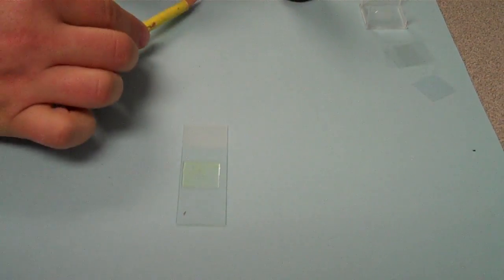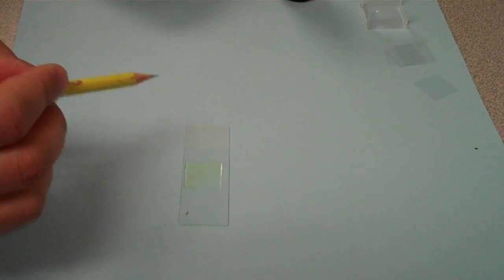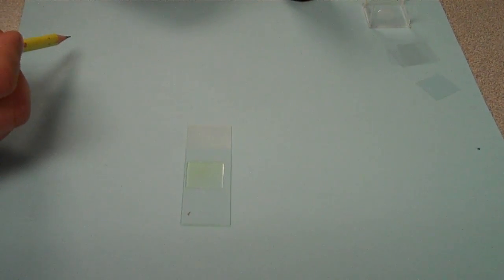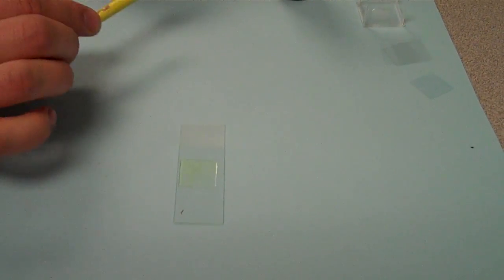If you do get air bubbles in there, if they're on your sample, you'll have to lift it up again, and lower it down again, nice and slowly. You might have to add a little bit more fluid.